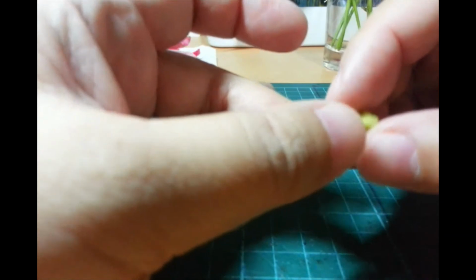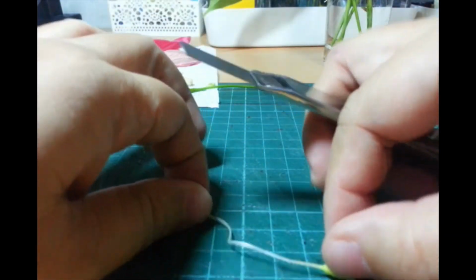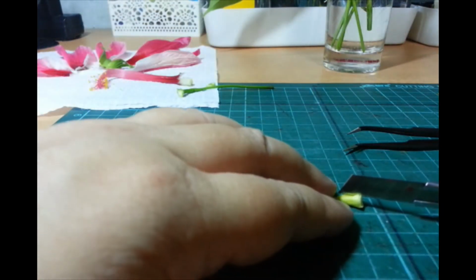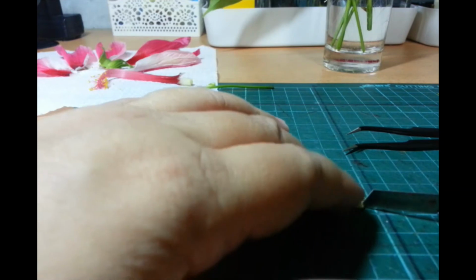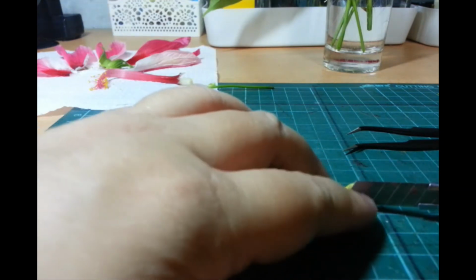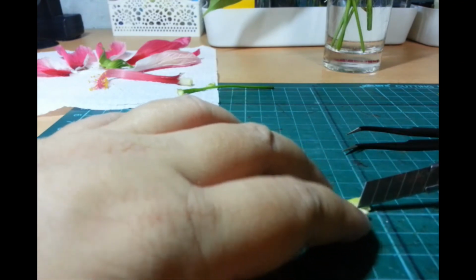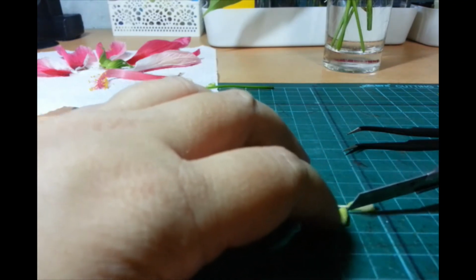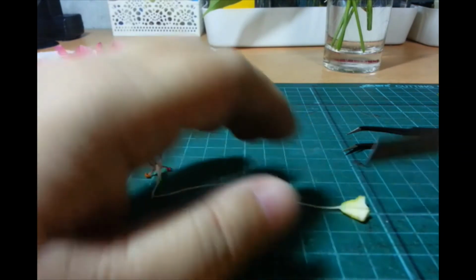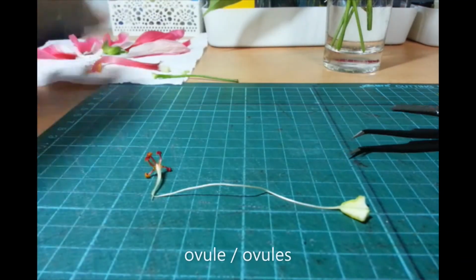Okay? So, this is the ovary. We cut it open. Let's see what's inside. Where I cut din kanina. Okay, so longitudinal cut sa ovary. Why am I not seeing anything? Ayun, wait. There. Nandun ako sa gitna. Super fleshy part. I don't know if you can see it. There's the ovules.